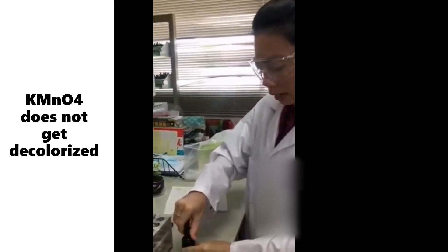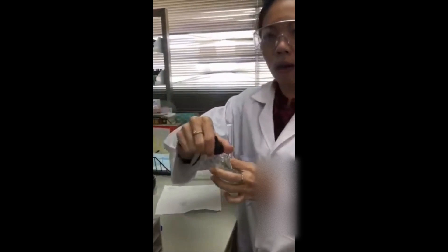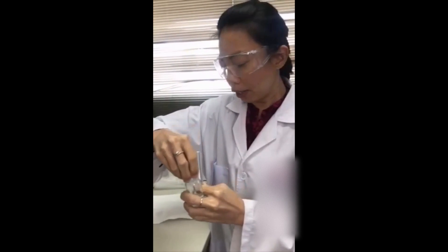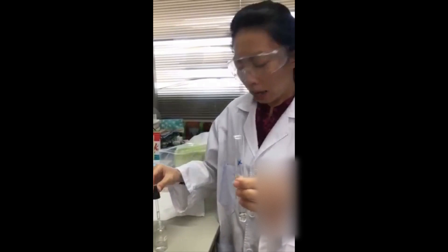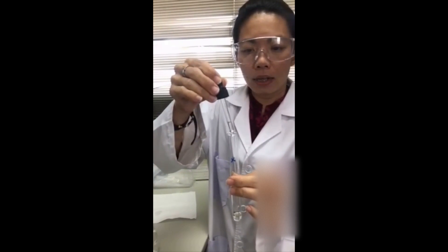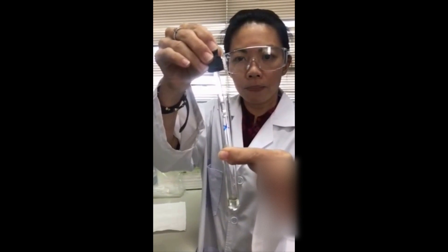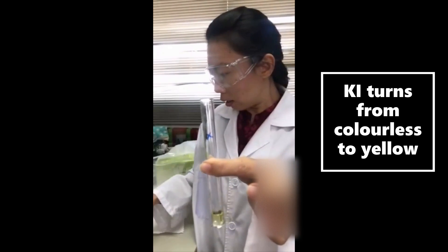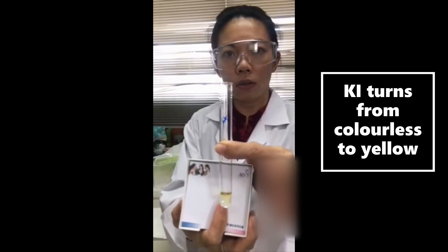The second test is X with potassium iodide. Potassium iodide is the reagent you use to check for an oxidizing agent. Let's see if X is indeed an oxidizing agent. If you look closely, the color of X turns more yellow than before, indicating that X is an oxidizing agent.